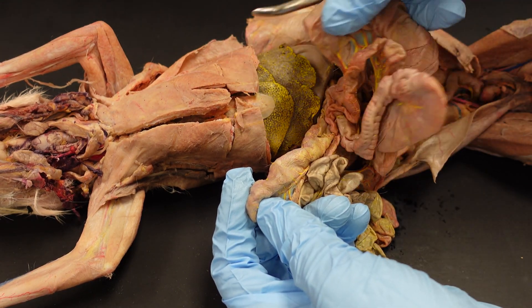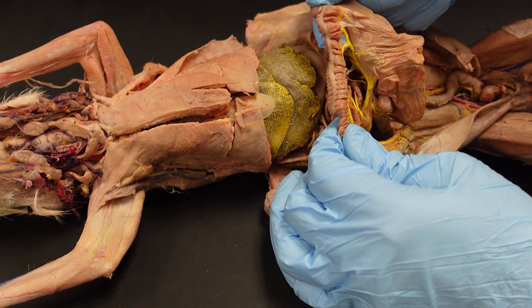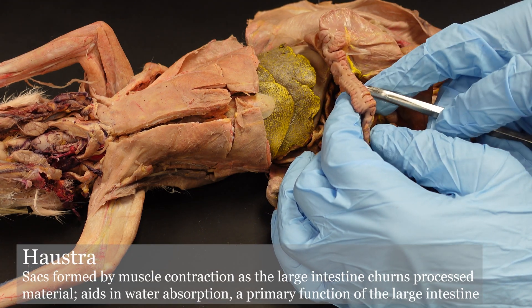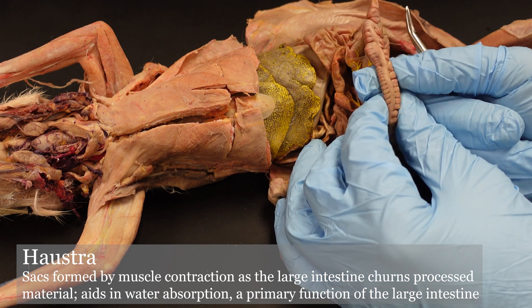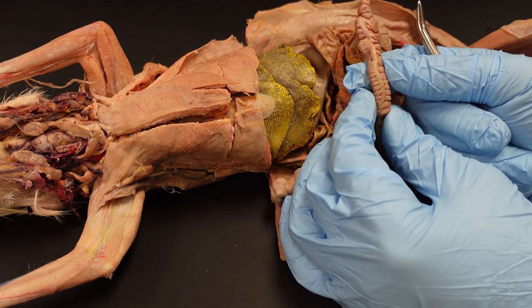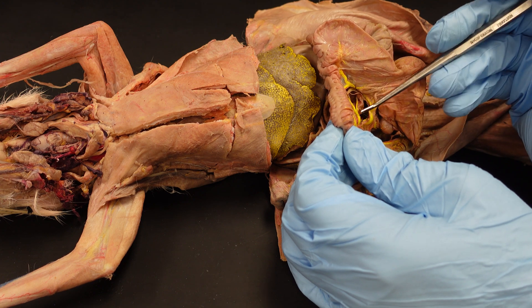We just follow it around and then we have our large intestine. One of the key features for identifying the large intestine is these folds — this is called haustra. If you've heard of haustral churning, that's moving material through this upper portion of the large intestine. They move in an undulating fashion — peristalsis, if I remember the term correctly.